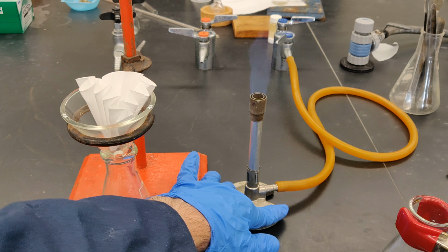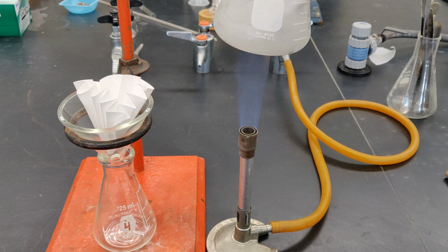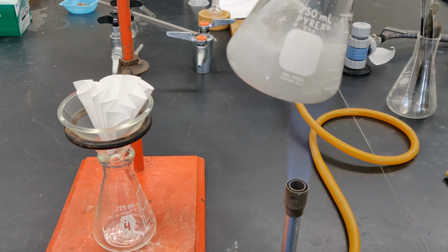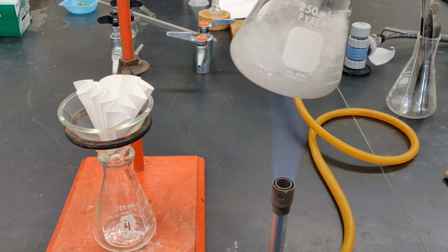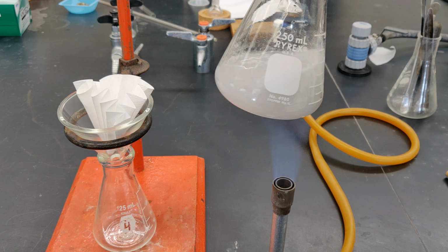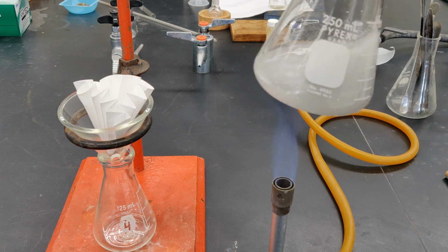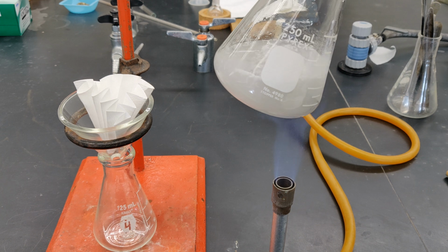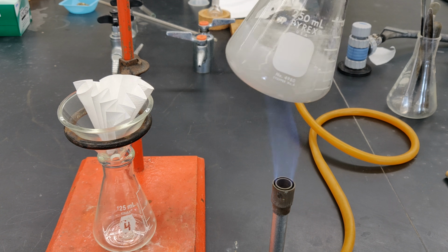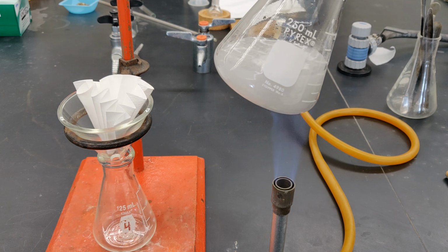Using the metal rod of the clamp as a handle, gently swirl it over the flame such that the flame's tip is in full contact with the bottom of the flask. Use a slightly circular motion to gently swirl the flask's contents. You want to avoid the splashing that would occur when you slosh the flask's contents in a side-to-side motion. With continued heating, the cloudy gray suspension will slowly clarify. This could take several minutes. Continue to heat and swirl periodically.